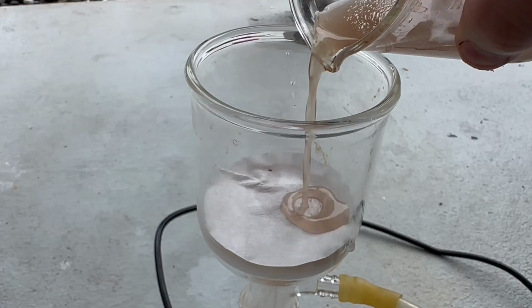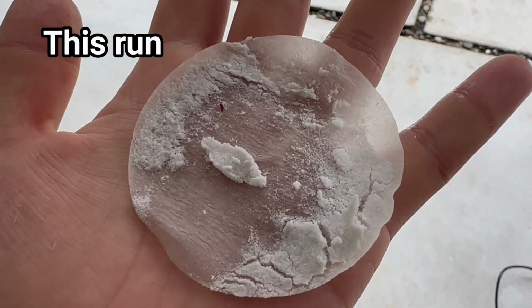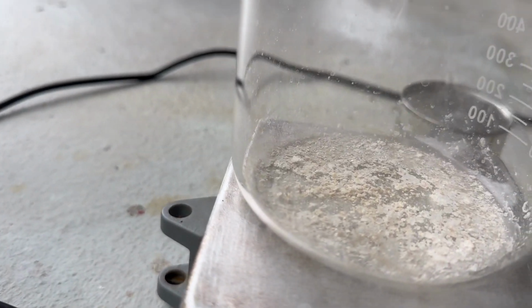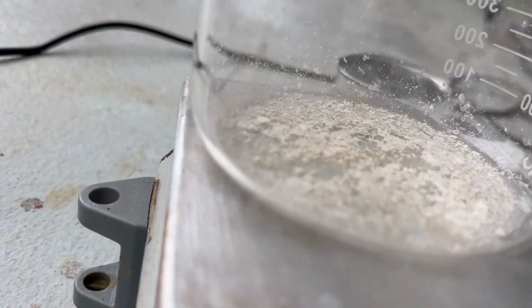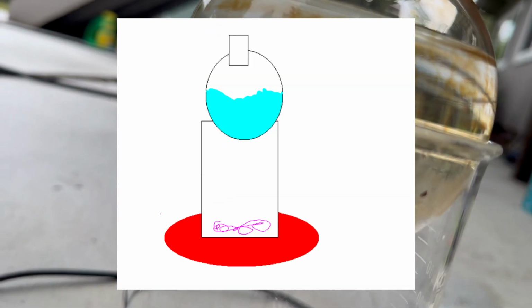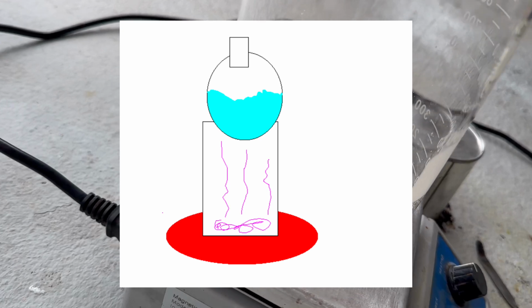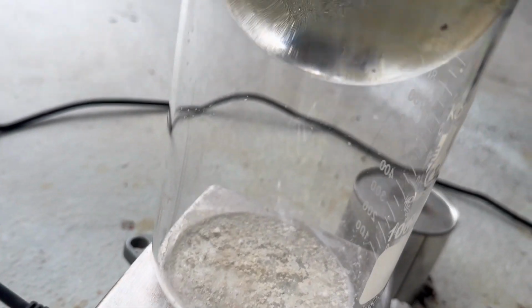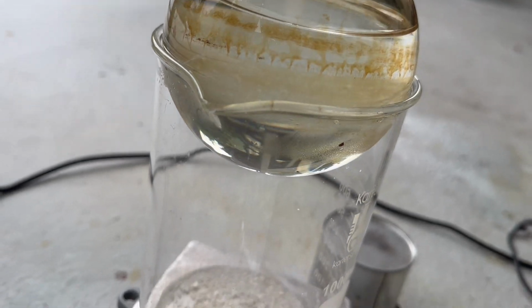After vacuum filtering both solutions separately, you can see this run has far greater yield than the previous one. Now, it's time to convert what's hopefully phthalic acid into phthalic anhydride. The popular method seems to be to heat the acid in a beaker to 200 degrees so the acid dehydrates and sublimes and is collected by the cooling flask on top. So I tried it, and my final yield was absolutely nothing.